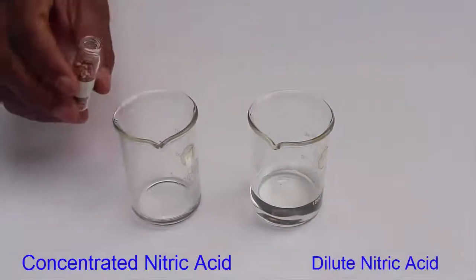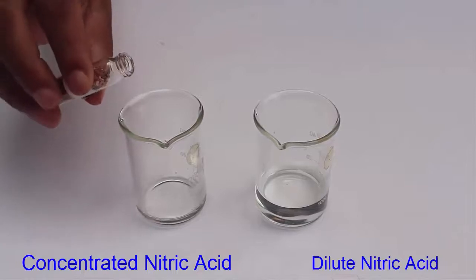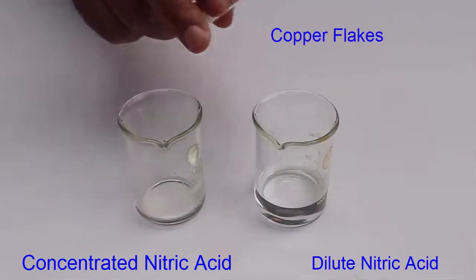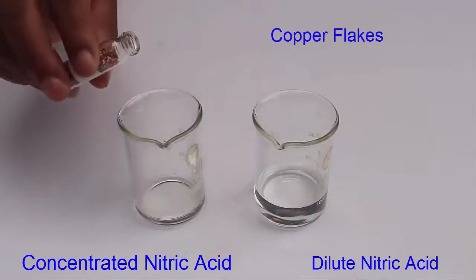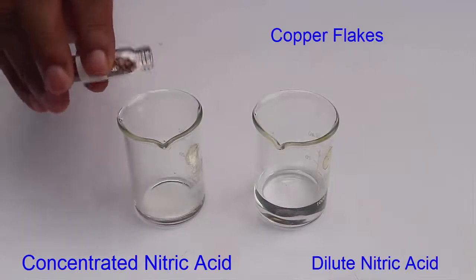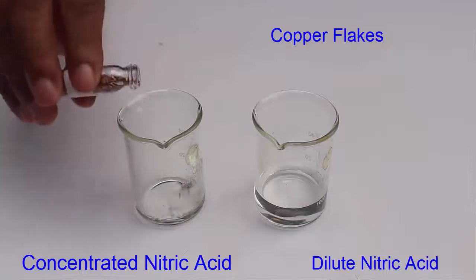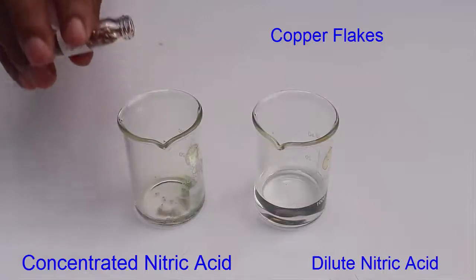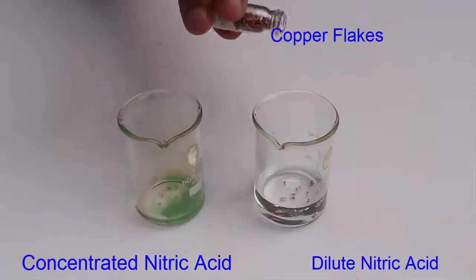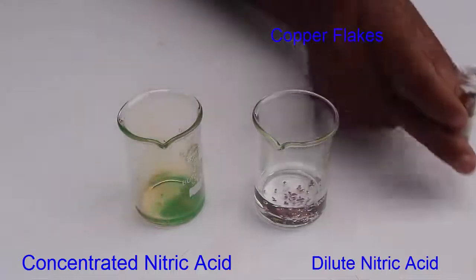Now we are going to take some flakes of copper. First place a few copper flakes in the beaker with concentrated nitric acid, and then a few flakes in the beaker containing dilute nitric acid. Wait for a little while.